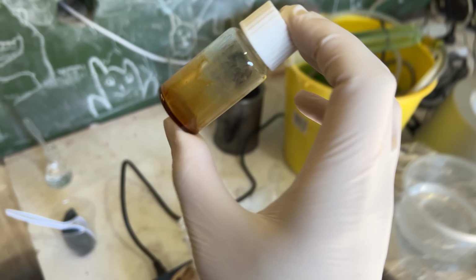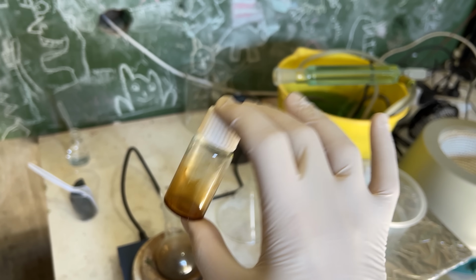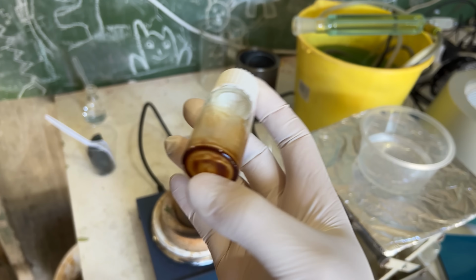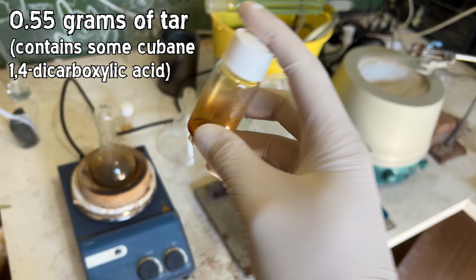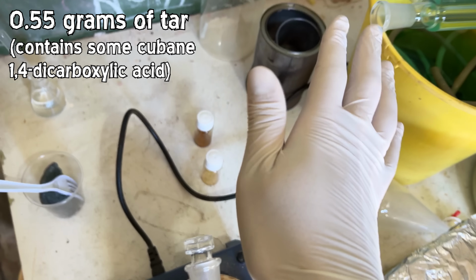I mean, of course, it feels very fitting that at the end, well, this isn't the end, but you know, our first sort of cubane is a tar, because the whole series has just been combating various tars. 0.55 grams of tar. So half a gram of tar. Great. So that is there. Right.